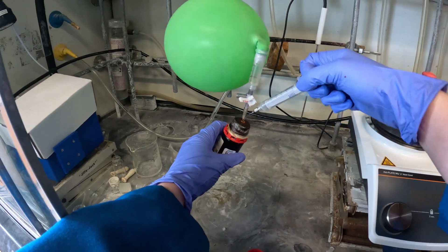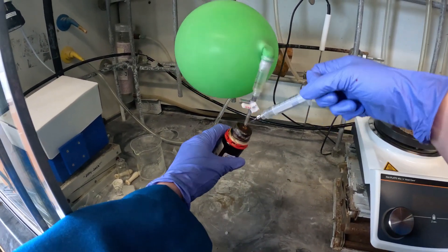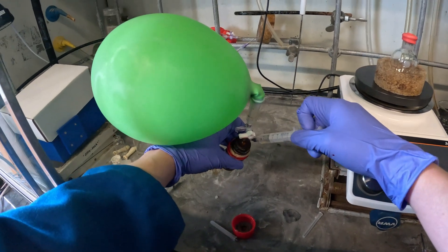Now I'm going to pull back and hopefully dispense the BBR3. It looks like it's not coming out. This thing's pretty viscous.